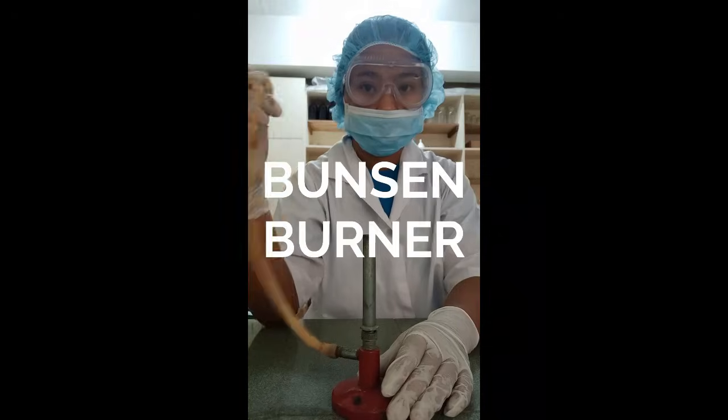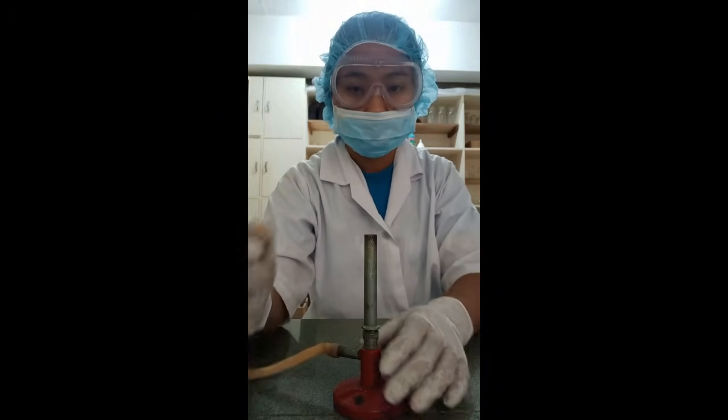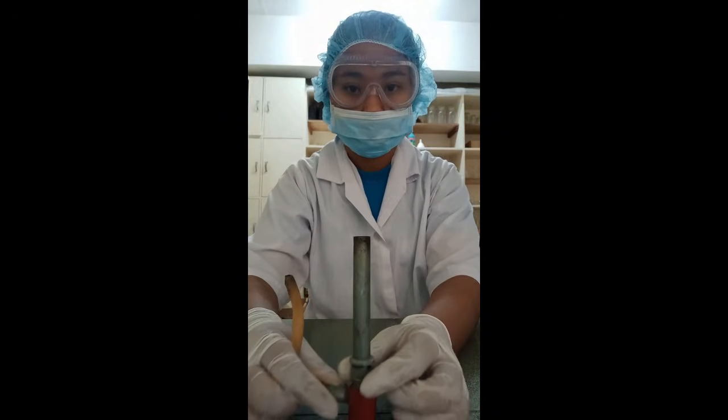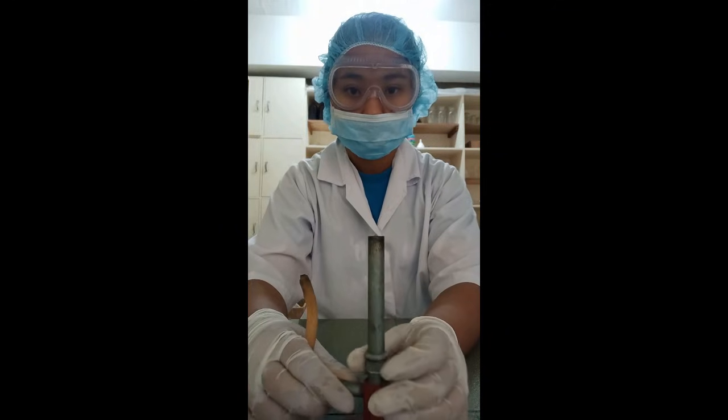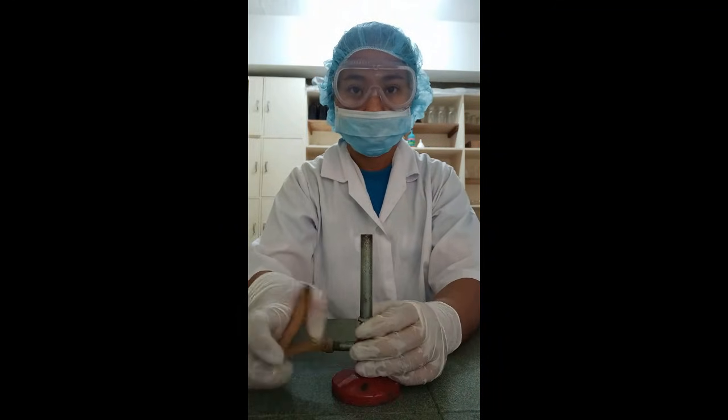Bunsen burner. It is a mechanical apparatus that is connected to a flammable gas source. It has a knob to adjust the amount of gas flow and a rotating collar that controls airflow.